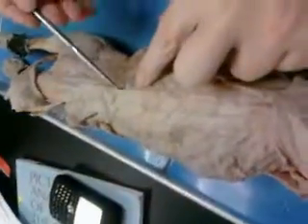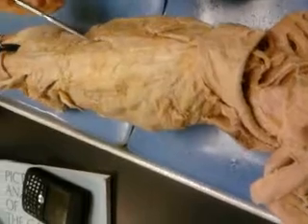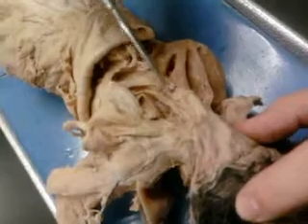The multifidus spinae, the longissimus dorsi, the iliocostalis, then we have the splenius, the rhomboideus, and the rhomboideus capitis. Then we have the supraspinatus, and then we have the infraspinatus, then we have the subscapularis, which is underneath the scapula, and then the teres major, which we can't see, but it's in there. And that's all of them.